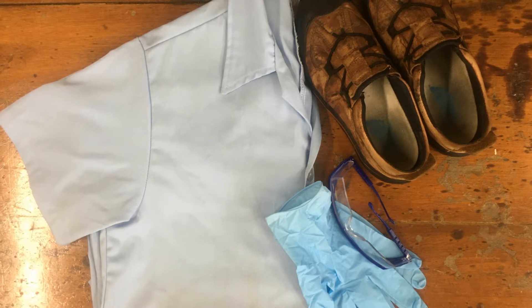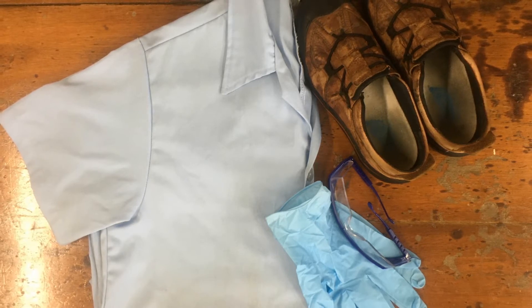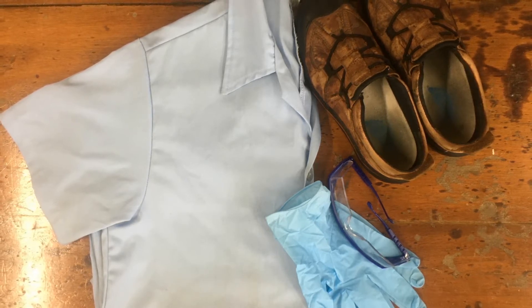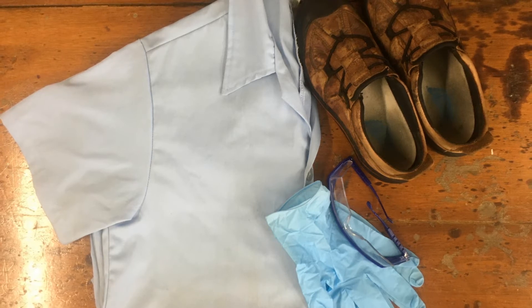Remember safety gear when working in the lab: our lab coat, safety shoes, gloves, and of course our lab glasses.